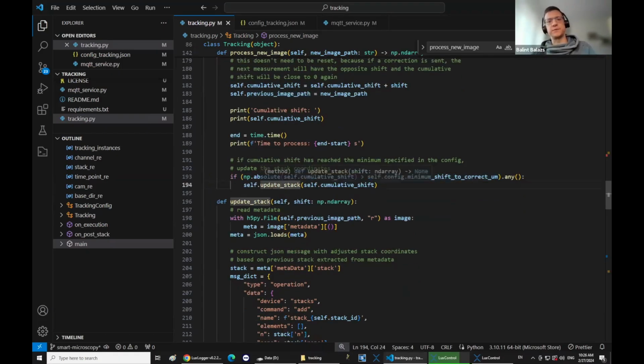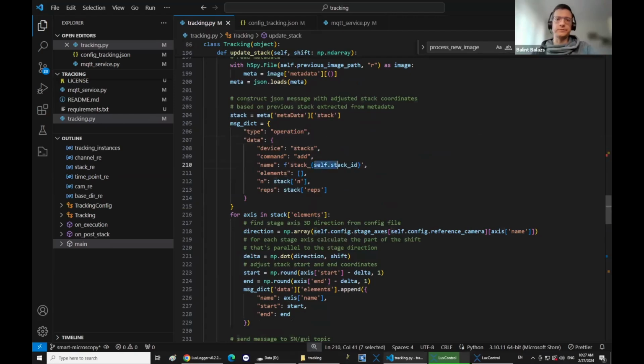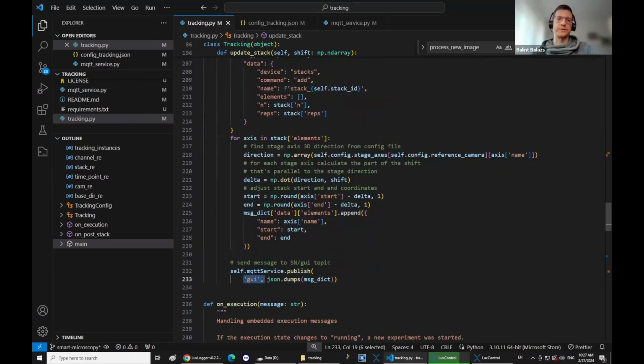And then it updates the stack, and basically what it does is just constructs a new JSON message from the stack ID and then the stack coordinates, and then publishes it under the GUI topic. So it just fakes it as if it was the user interface, and basically the microscope picks it up and updates the coordinates. On the next time point, it will take the stack at the new coordinates. So in the beginning of the experiment, there's only one stack added to the list of acquisitions, and then they get added iteratively.